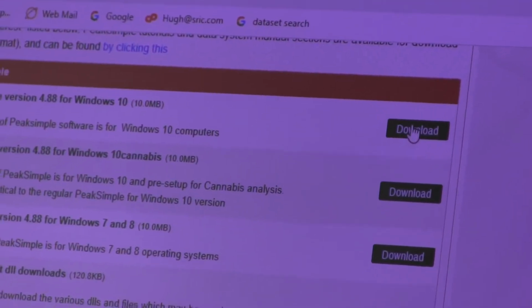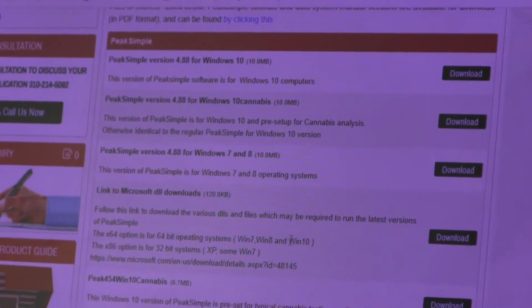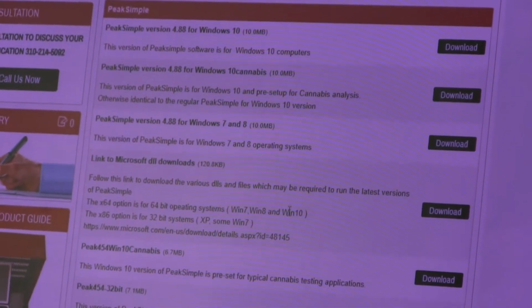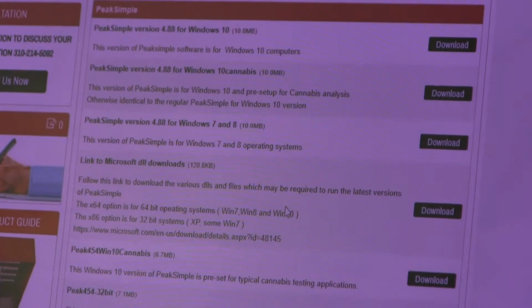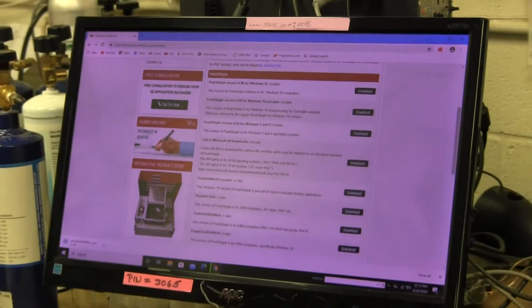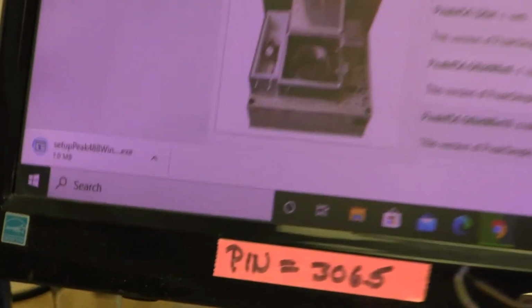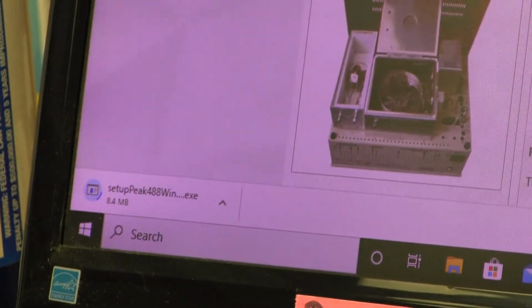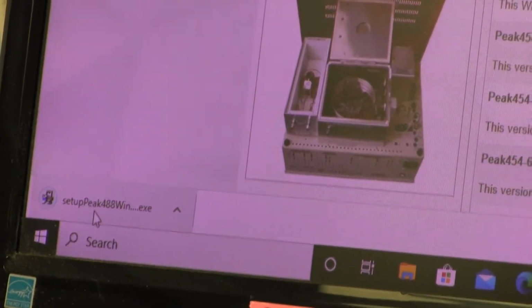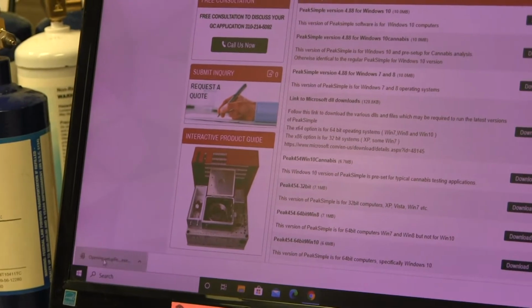So we'll click the download. It's about a 10 megabyte download. So I'm halfway there now. The download is a setup file which contains all the necessary files to start up the software and communicate with the GC. So it's done now, so I'll double click here where it says Setup Peak 488 Win 10.